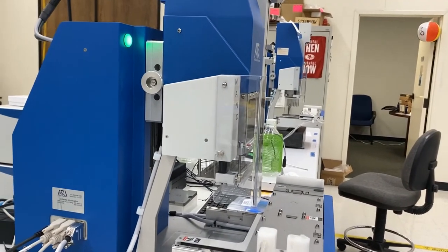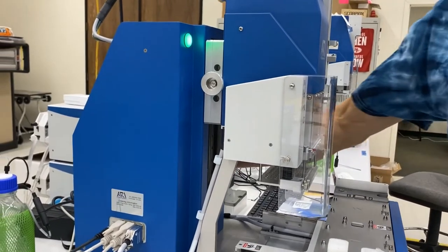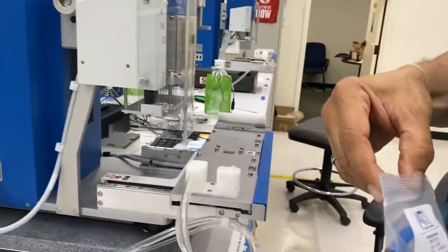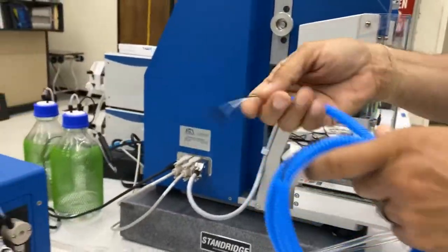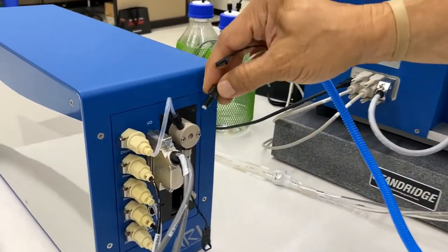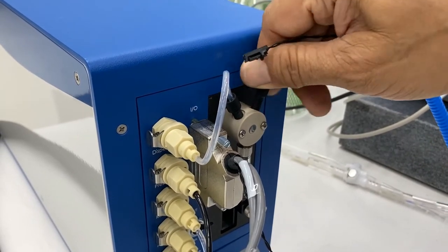How to change an ARI nano nozzle. Power off the system. Remove the nozzle from its bag. Remove the protective cap and insert into the nano syringe drive.